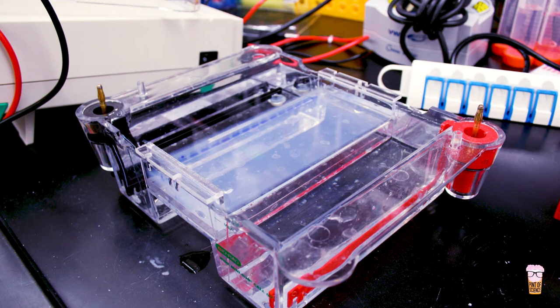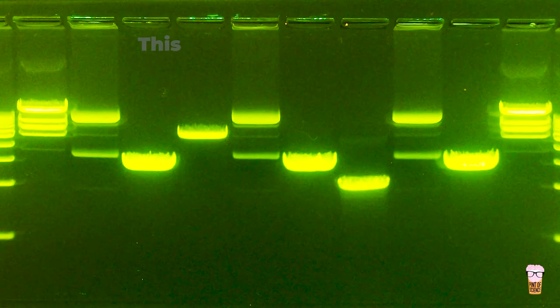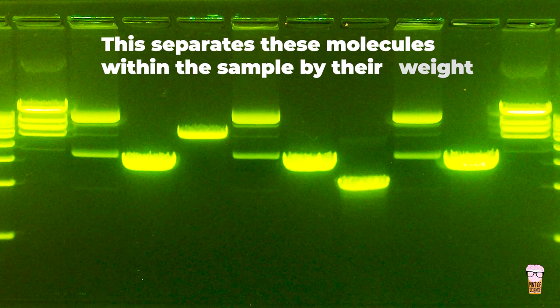To do this we collect a tiny piece of muscle tissue and we cut it up very very fast with scissors to release the molecules from within the muscle sample. We then prepare this sample for a process called gel electrophoresis, which separates these molecules within the sample by their weight, because our molecules have different weights.